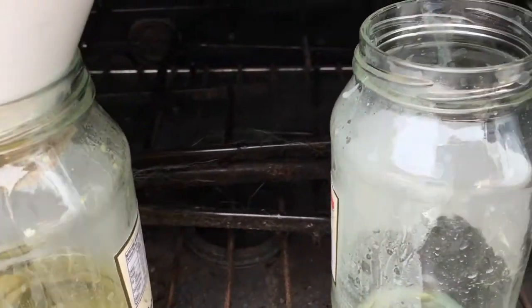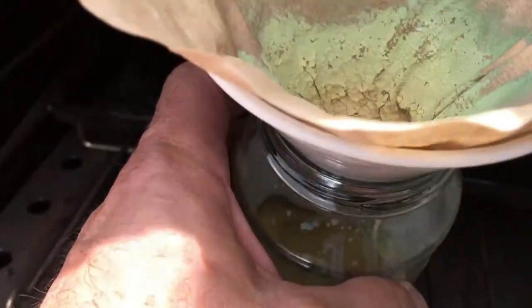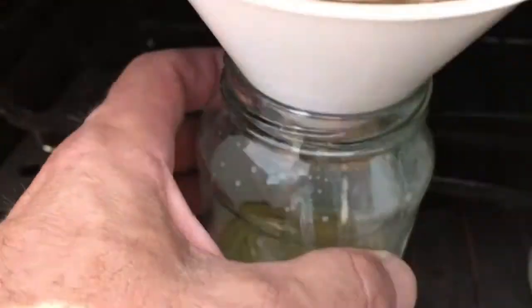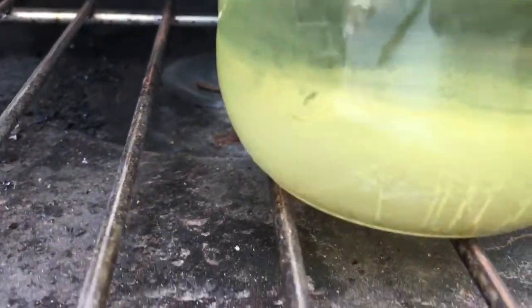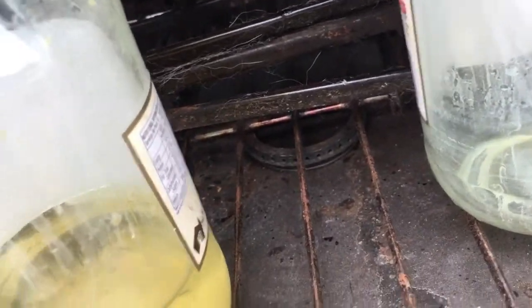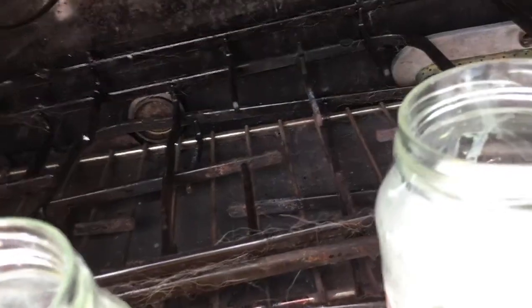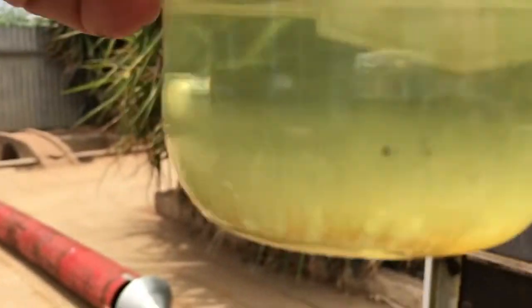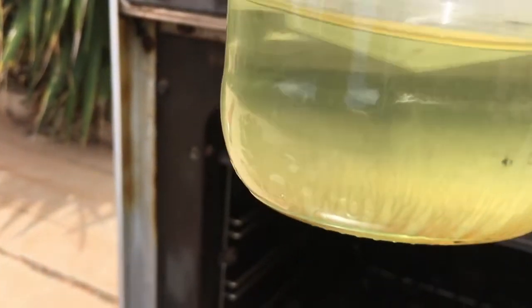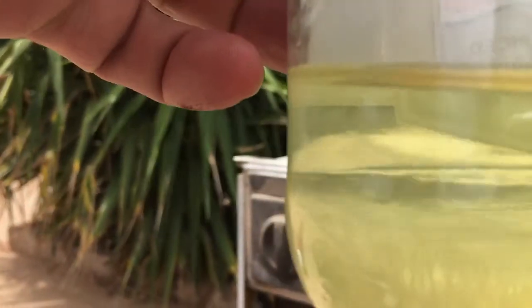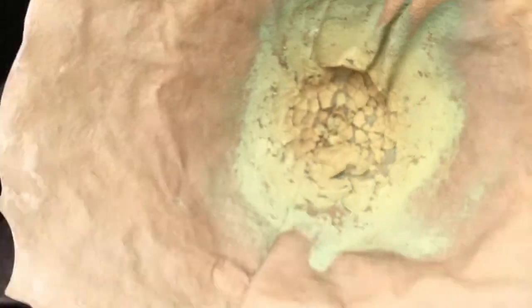I'm back. It's been four days of draining the solution. It's turned a greenish sort of weird colour there for some reason. Not sure why. I don't have too much left in the bottom of that. So I've filtered out most of it pretty well. It's quite dry. I kept it in this oven outside because it has a sort of slight bit of almond smell to it. So I'll crush up this stuff, collect it, weigh it, see how much we've got.